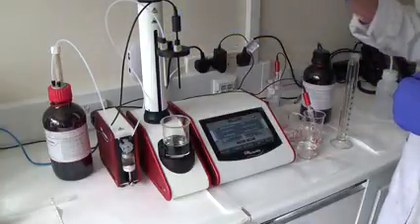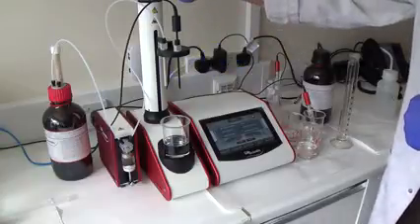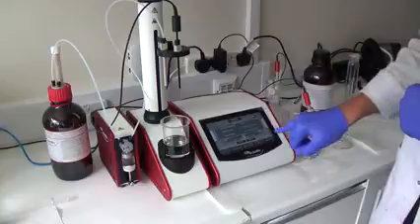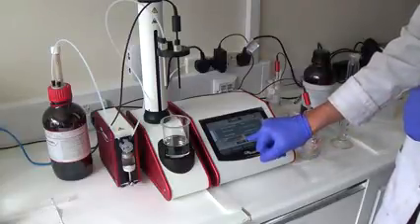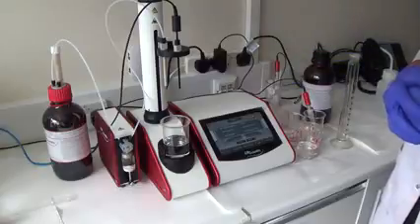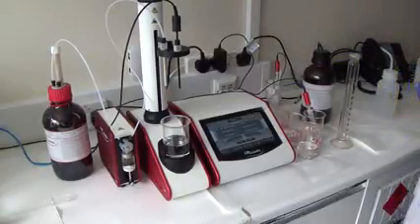So now I've double checked the lines as well. This is also very good to make sure there's no air bubbles. If you need to do that from the homepage, you can press flush. And it would perform a three-cycle process again, just to purge out all that air. So now we're ready to run our sample.